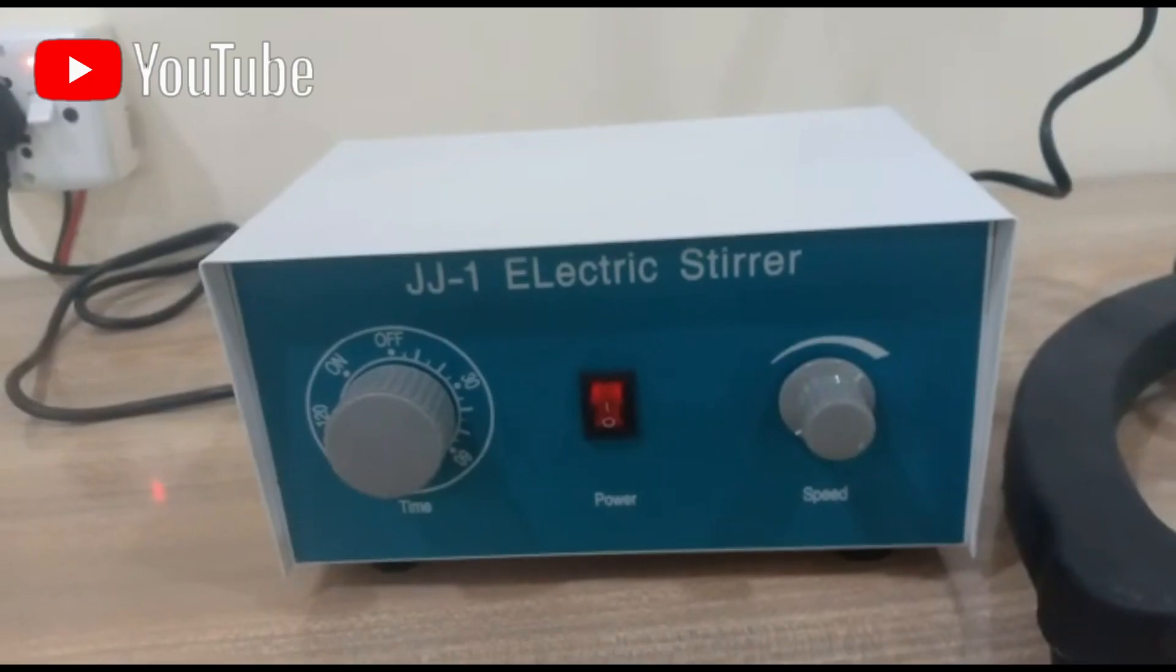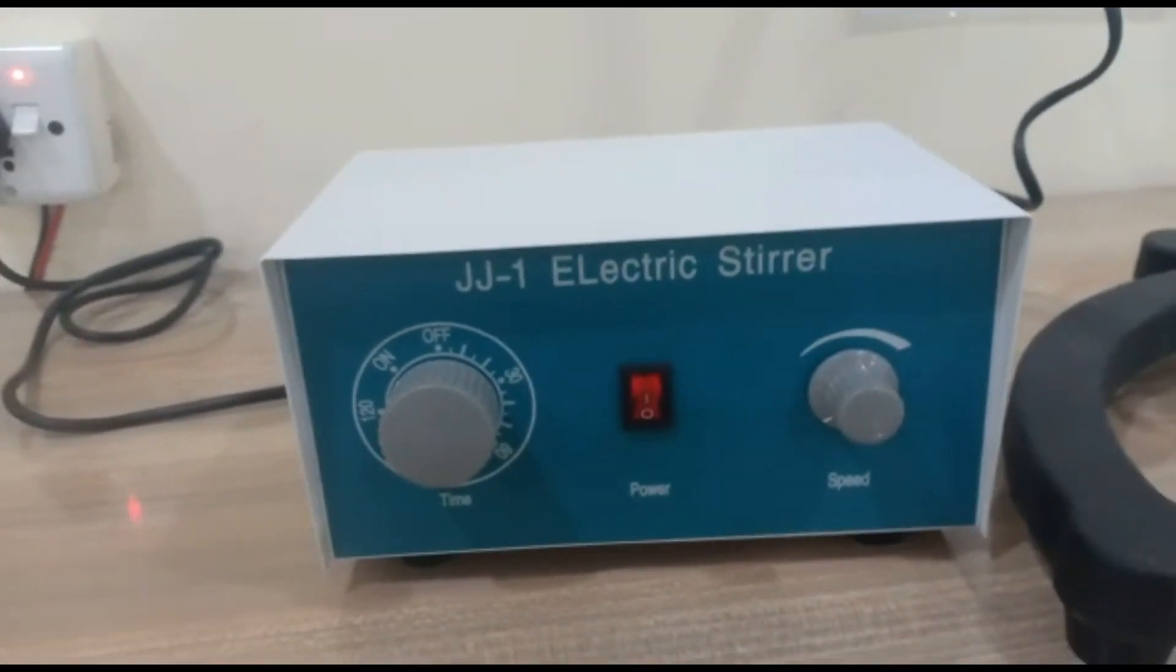Stay with us until the end of the video so that you can understand the proper working and use. This instrument is present in our University of Chakshizad Islamabad campus.